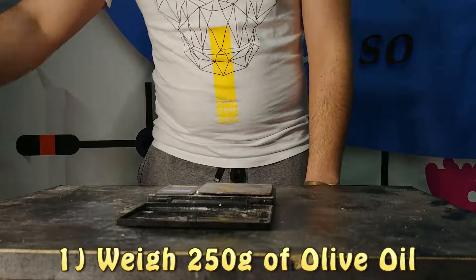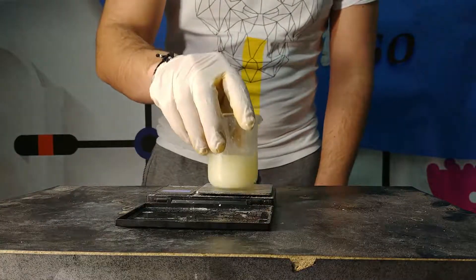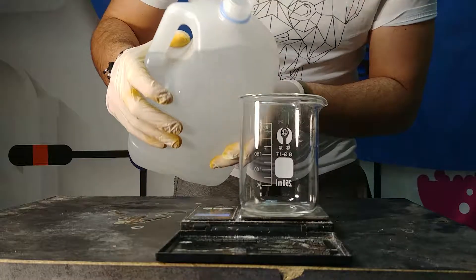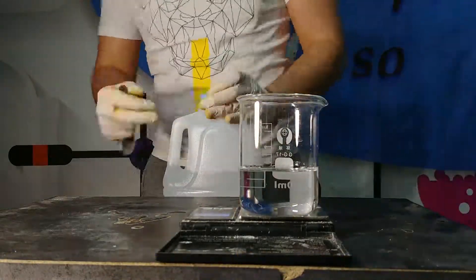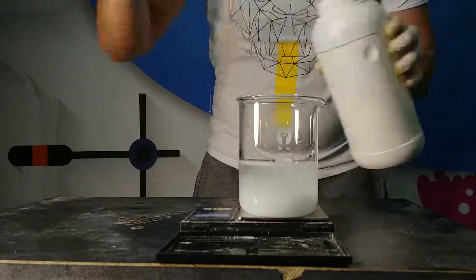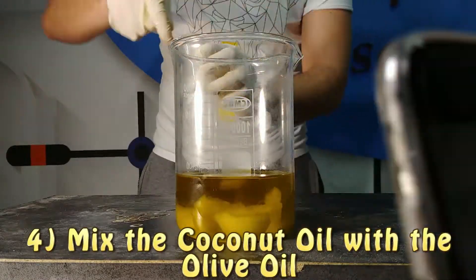The experiment consists in firstly pouring 250 grams of olive oil. Then we are going to pour into another beaker 150 grams of coconut oil. It is solid, so before mixing the two oils you should melt it down with a little bit of heat. Then we are going to prepare a sodium hydroxide solution containing 40 grams of sodium hydroxide in 100 milliliters of water.